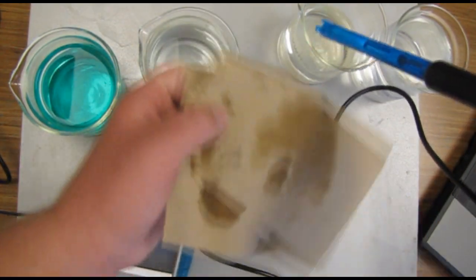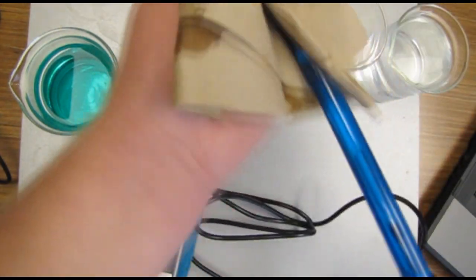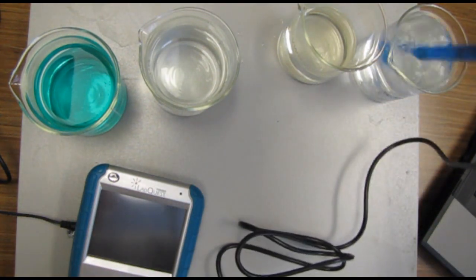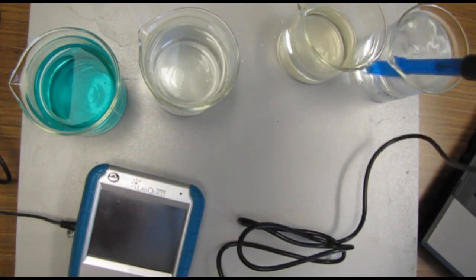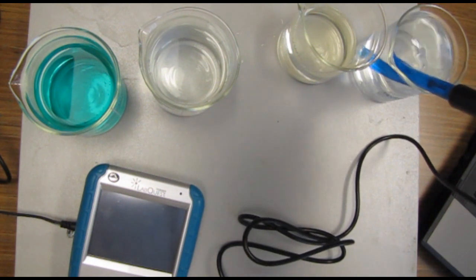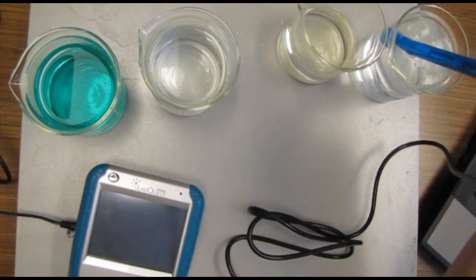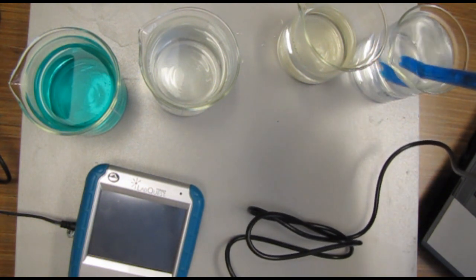Okay, I'll just pull it out and I'll wipe it off and I'm going to just rinse it off with the distilled water. You want to use only distilled or deionized water with the pH sensor probe.